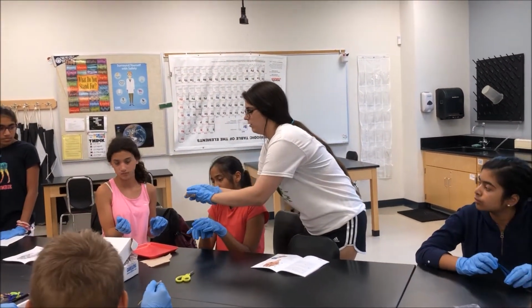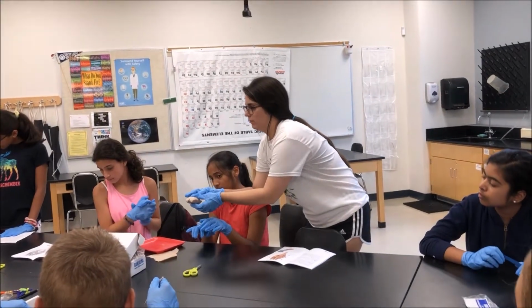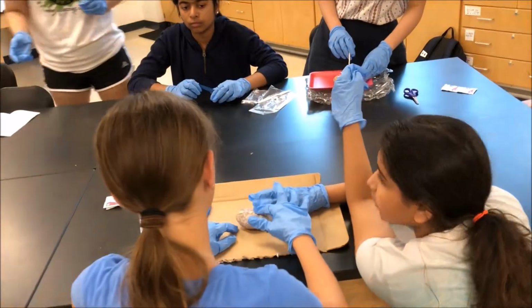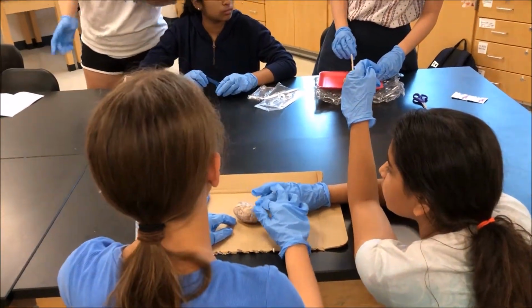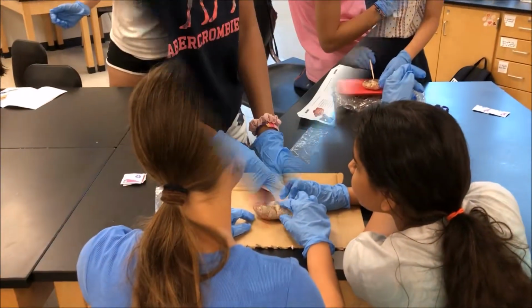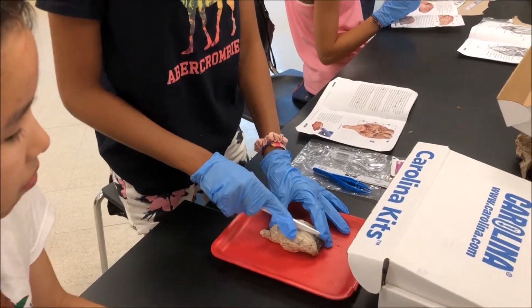So over here is the midbrain. Is it this? This thing? Yeah, that. So like here? Good. It looks like it, and then almost flip it over, attached to the cerebellum. Oh yeah. Yes. So we go like, wait, the right, just straight like that.